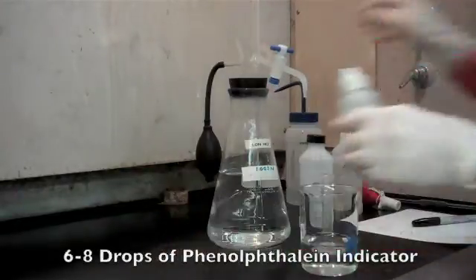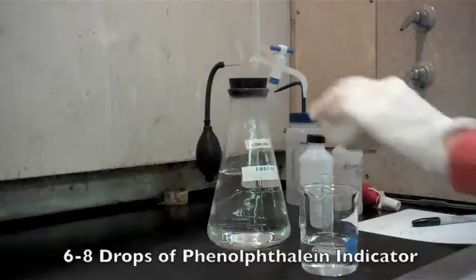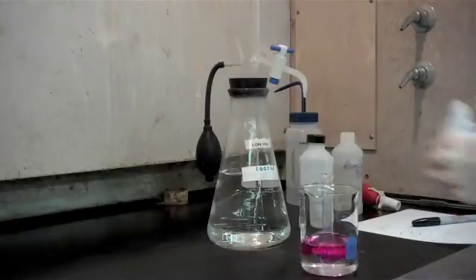Then we're going to add 6 to 8 drops of phenolphthalein indicator, and our solution is going to turn a nice bright pink color.